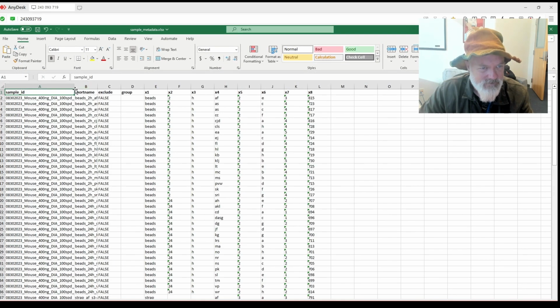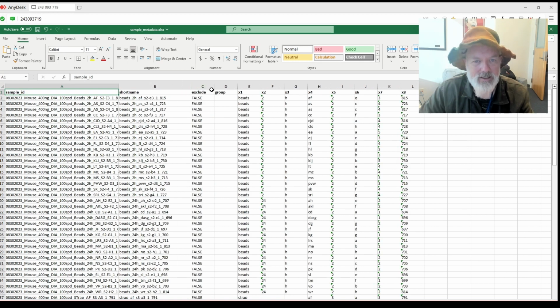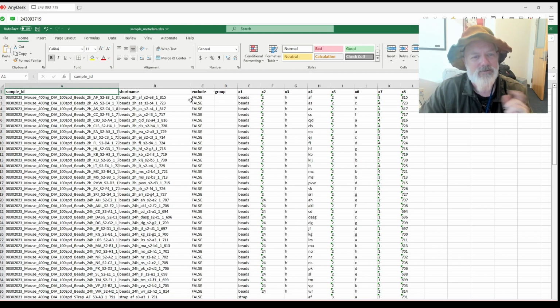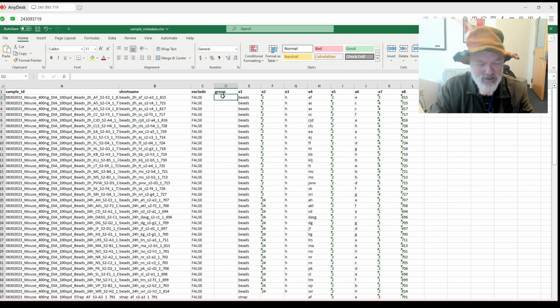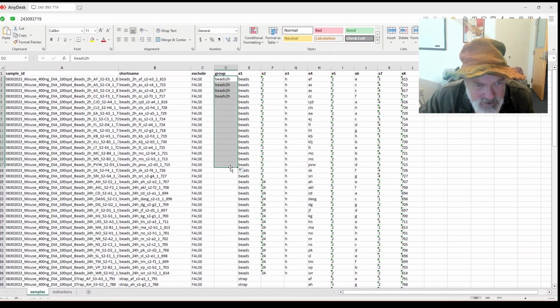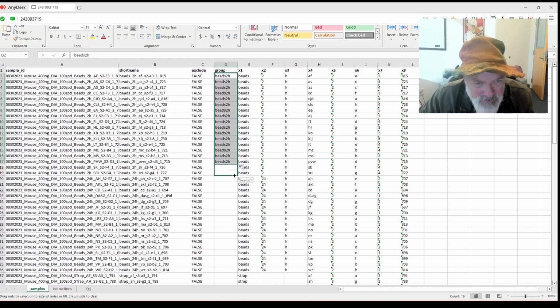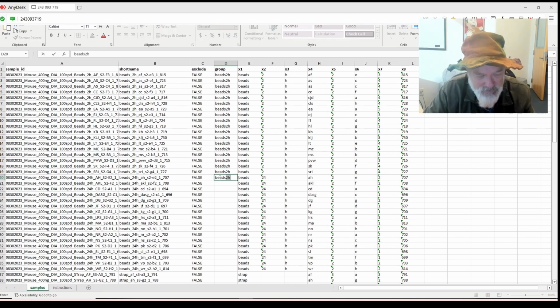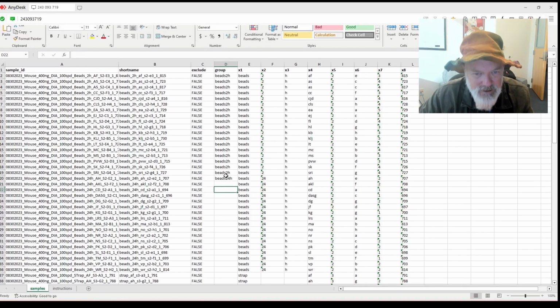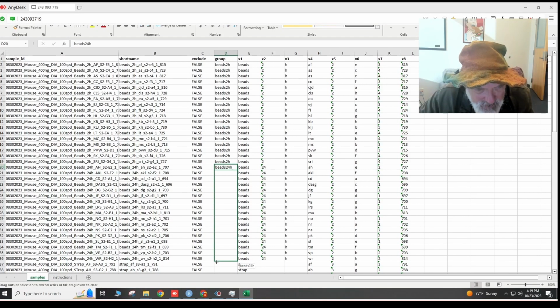So it gives you all the file names, the short name, exclude, which is what we do if there's something bad with the sample. Group is condition, and then it tries to parse out a bunch of stuff. I don't really know what these do, but you can see we have these in the file names. So like this one is our bead digest. So I'll say beads. I'll give this a condition 2 hours, and then I'll just drag it down to all the 2-hour ones like this. I think we have a couple more. I'm not wearing my glasses because they're kind of broken, so I'm going to have to squint a little bit. Beads, 24 hours. Okay, let's see if I can do this. You drag this little thing down here, 24 hours.